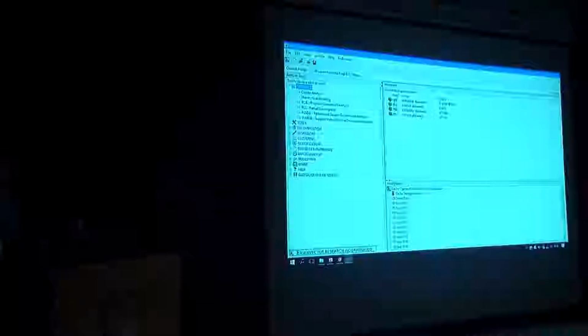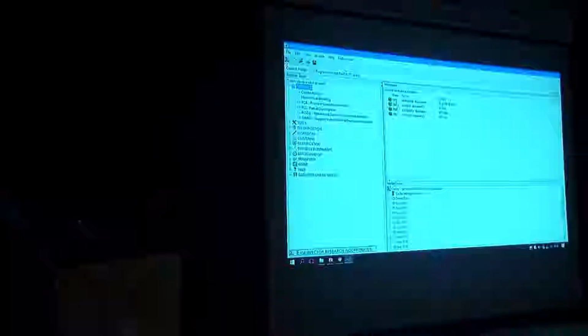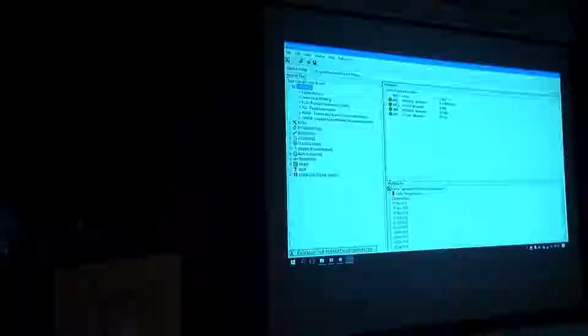So, let me introduce you to the data set. CRX is calibration data, raw, X: spectra, calibration spectra that are raw. The interesting thing about this method is you work on the raw data, no derivatization. Derivatization can cause problems. You lose information. You need to interpolate, you need to smooth, you need to have some assumption about the degree of smoothness. So with minimum pre-treatment, we just want to identify directions in the data set that are interference, and we want to remove them. Ideally, those directions are independent of your signal directions, and that's not always the case. Sometimes these two are correlated and collinear. But for this data set, you will see it will work perfectly.